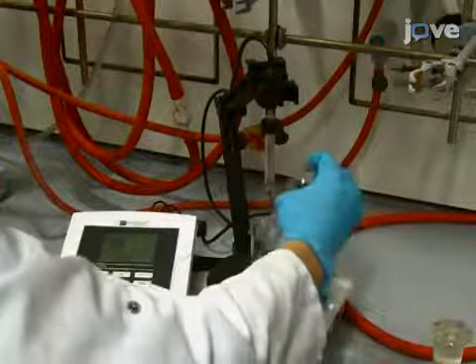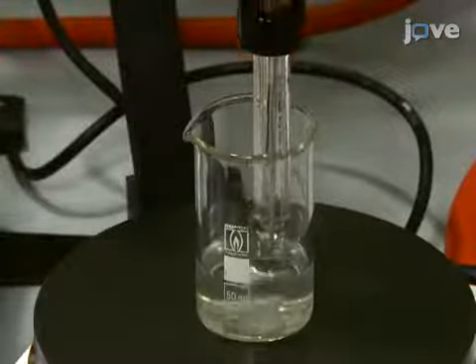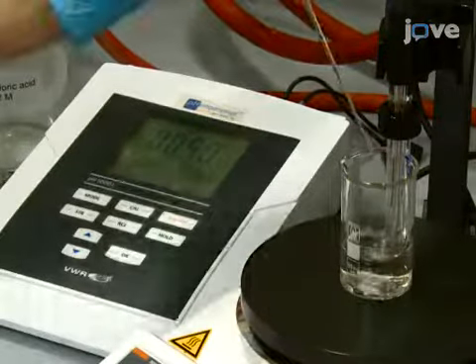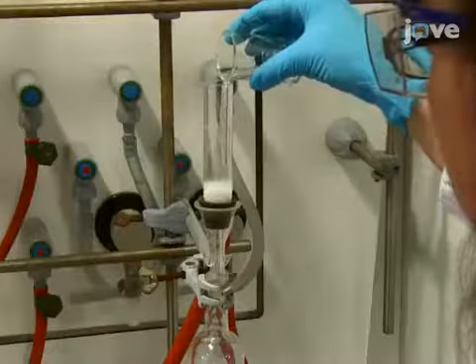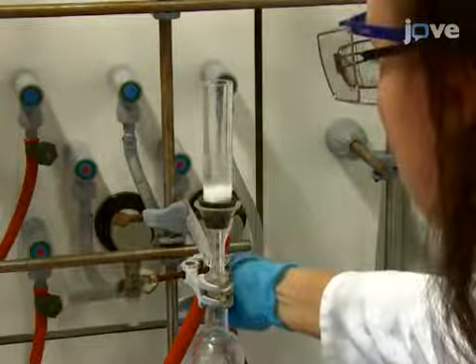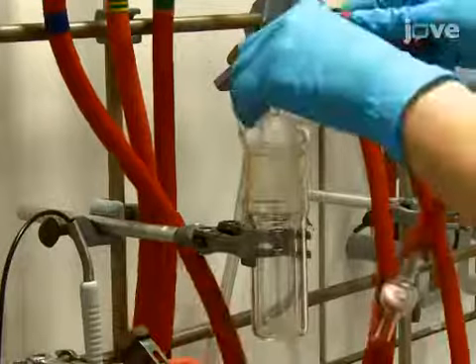Next, combine the aqueous filtrates in a beaker and place a pH electrode in the solution. Add 12 molar hydrochloric acid to the filtrate until the pH is about -0.1. After removing the solvent in vacuo, wash the residue thoroughly with hot ethyl acetate to remove the excess oxalic acid. Then dry the residue in vacuo.